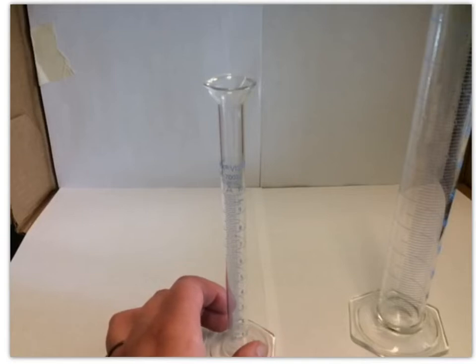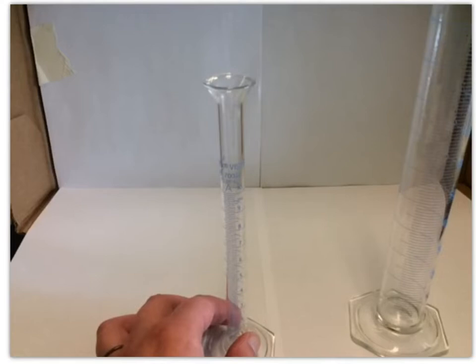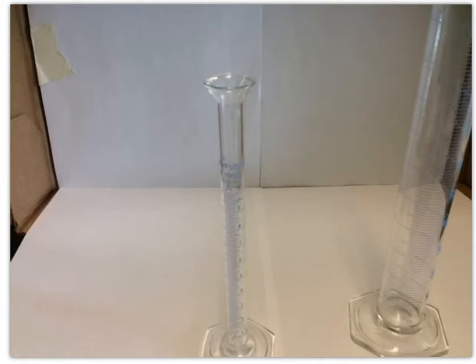That estimated decimal place is up to some of your own judgment. Some people may come up with a little bit different value for that estimated digit, but it should be close. But the tick marks are a definite reading of where the measurement is, on a tick mark or between.